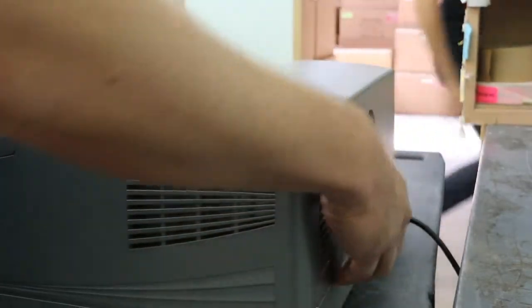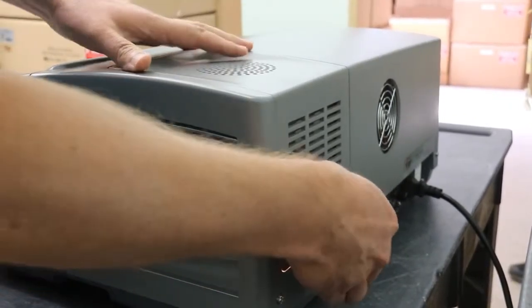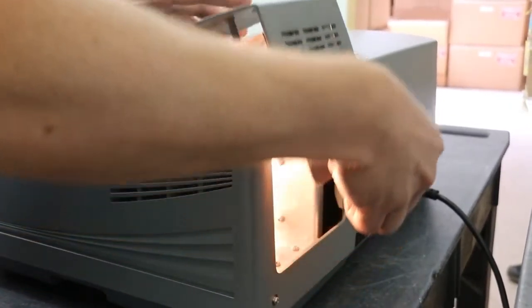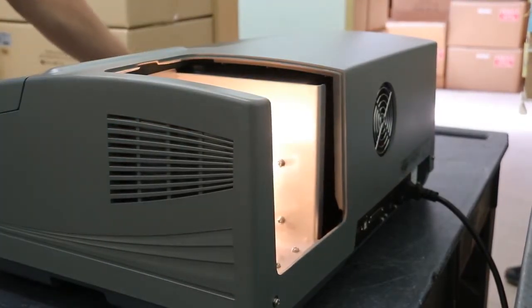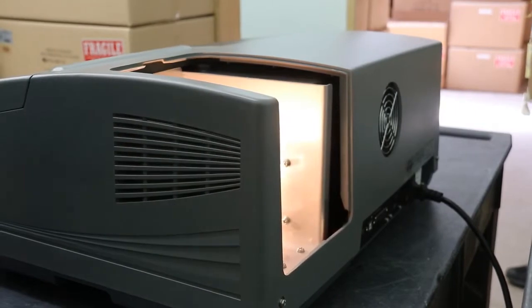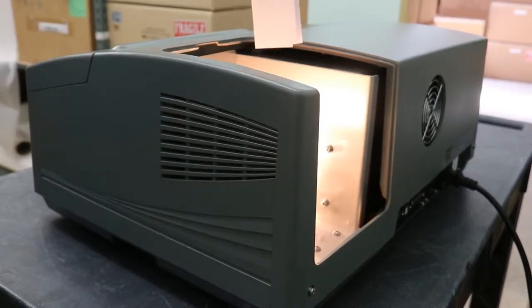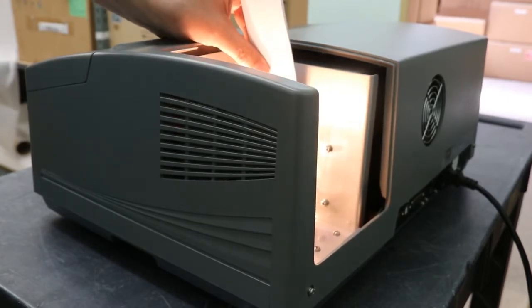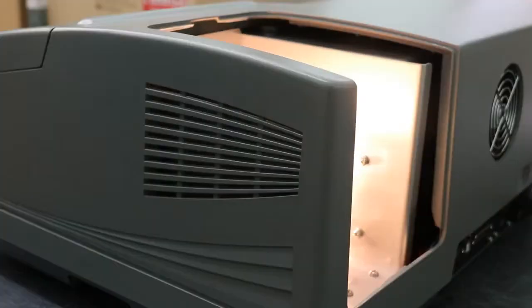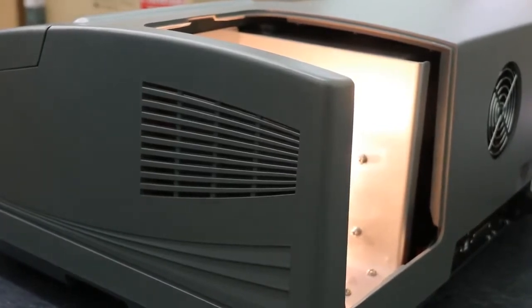To check the lamp, simply press on the plastic and lift. To test if the light is on the slit, simply place a piece of paper in front of the slit to see. If either lamp is out, the lamp will need to be replaced.